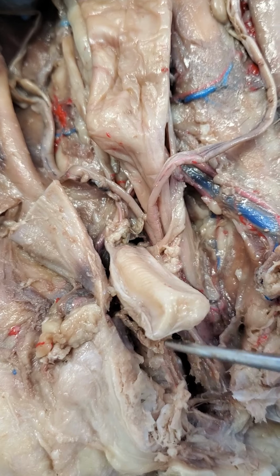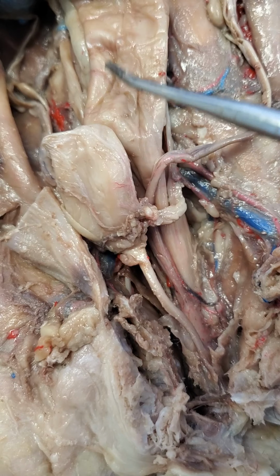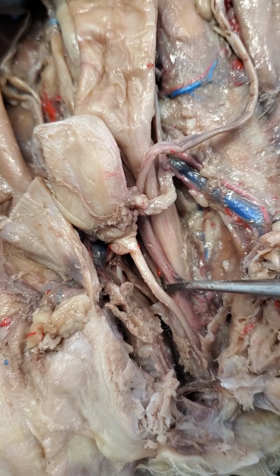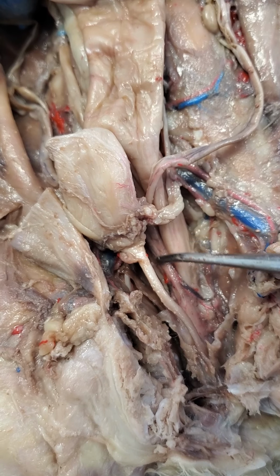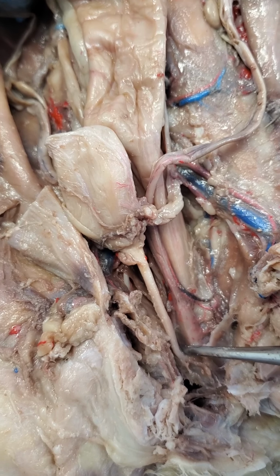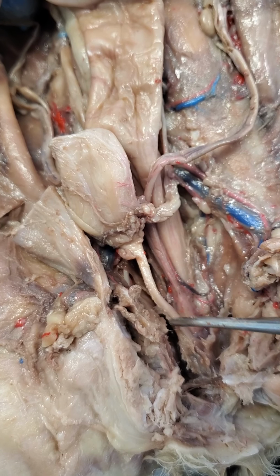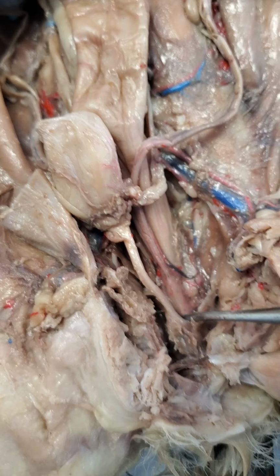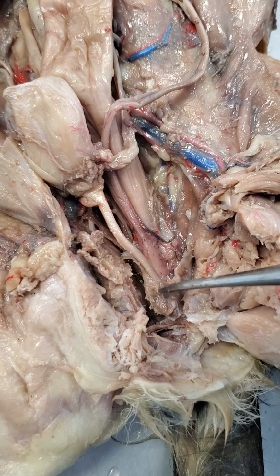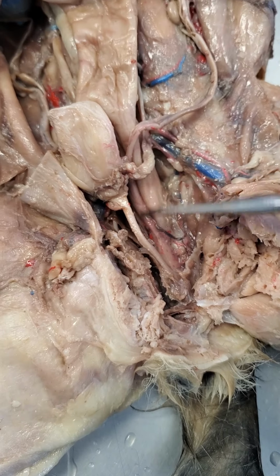All right, and if we fold this back up, so we're covering that up with the bladder, you can see that that uterine body is right here. And at the base of that uterine body, this is where the vaginal tract begins. All right, so this is all the vagina, and the vaginal tract is going to continue down until right about here, where it's actually going to merge with this urethra coming off of the bladder. So this point right there at which they merge, everything after that, this whole area below it, is called the urogenital sinus.